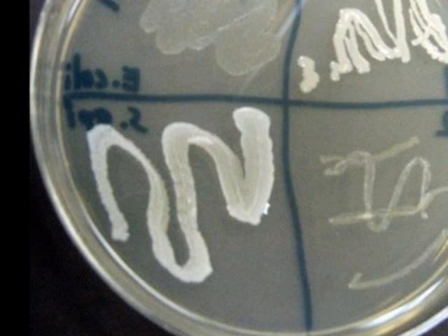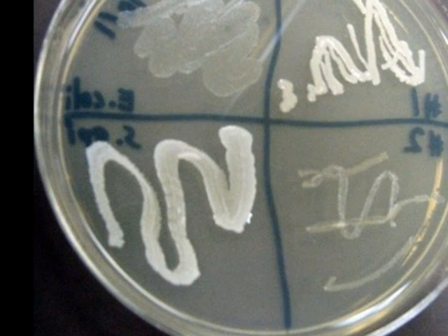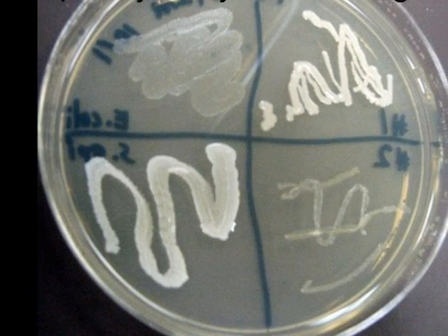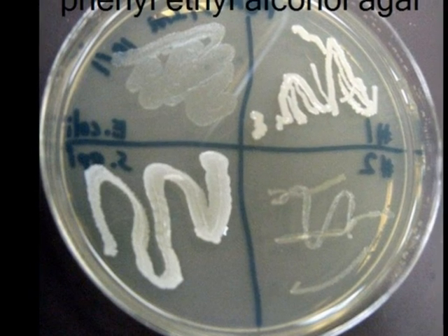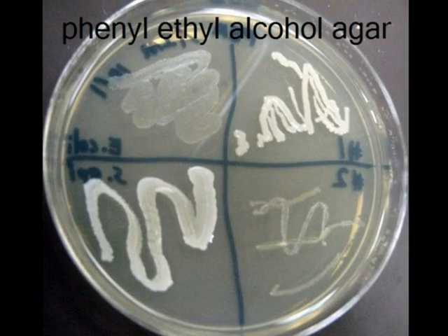For good growth, interpretation would be, the microbe tolerates the phenylethyl alcohol and is most likely gram-positive. For the poor growth, interpretation would be, the microbe cannot tolerate the phenylethyl alcohol and is most likely gram-negative.